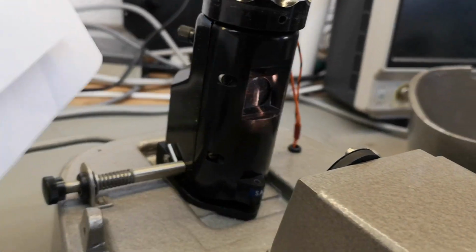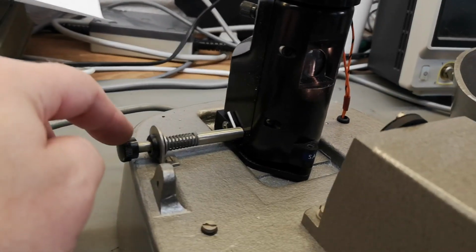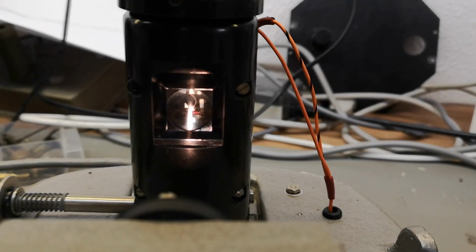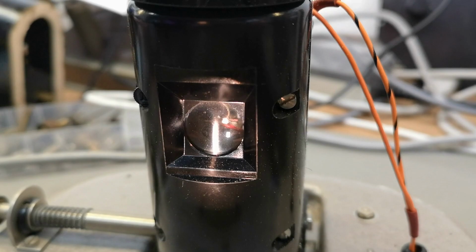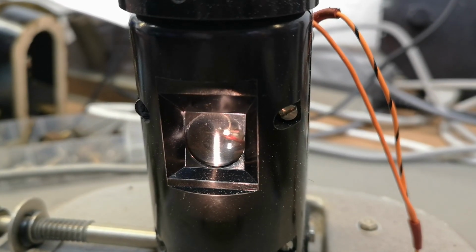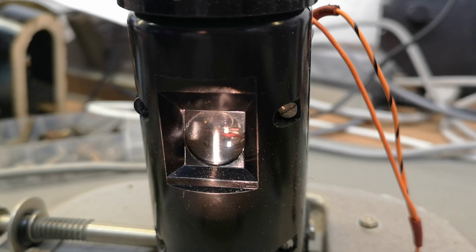So there's a meter, a galvanometer. So I hit the release, so now it's free. I don't know if you can see this. Let's see if we can. And then if I put in the paper here, so I block the sensor. Can you see there's a little mirror, a tiny little mirror in there that moves? And then there's another line that is now moving, right?